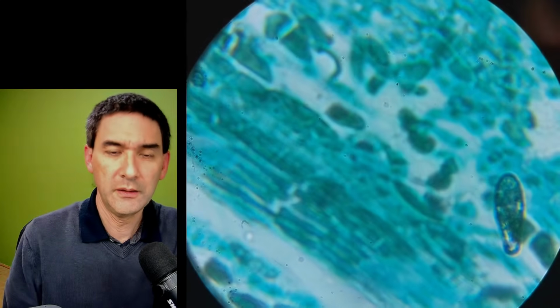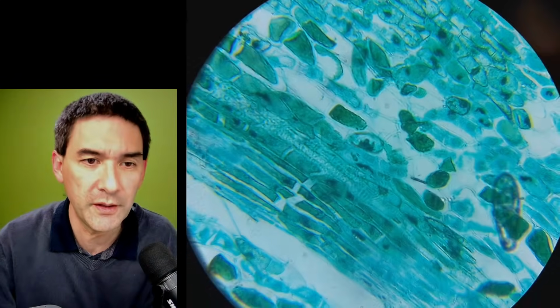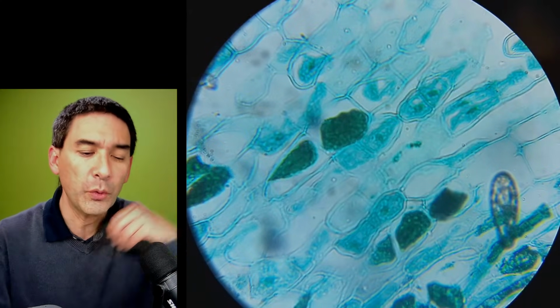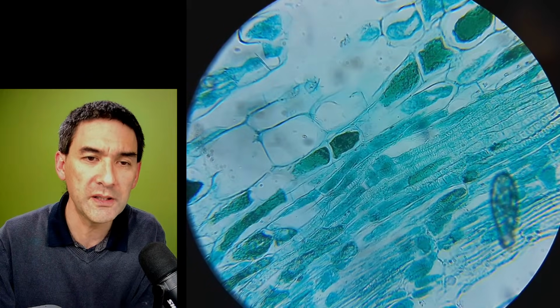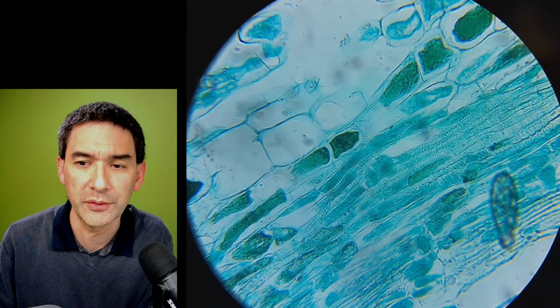Here we go. Okay, I have to basically lock the exposure. But you see that actually even with the cheap optics of this microscope, yeah, it's trying to refocus again. So I have to do again a focus and exposure lock. Even though with the cheap optics and without a condenser of this microscope, we're actually able already to see quite a lot.